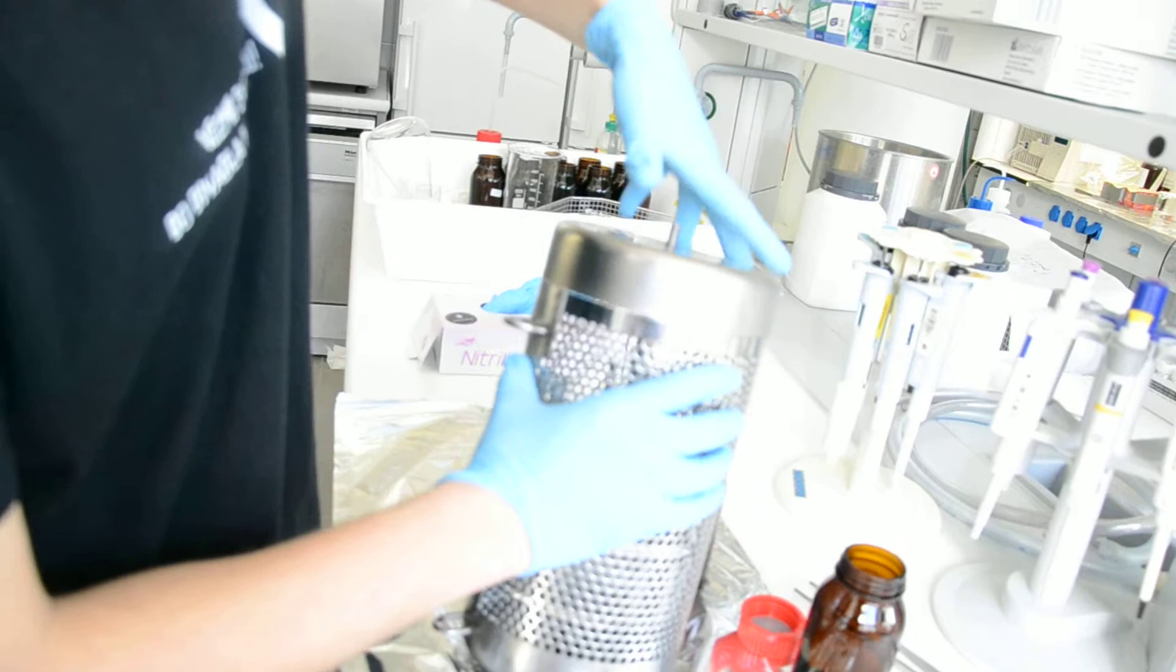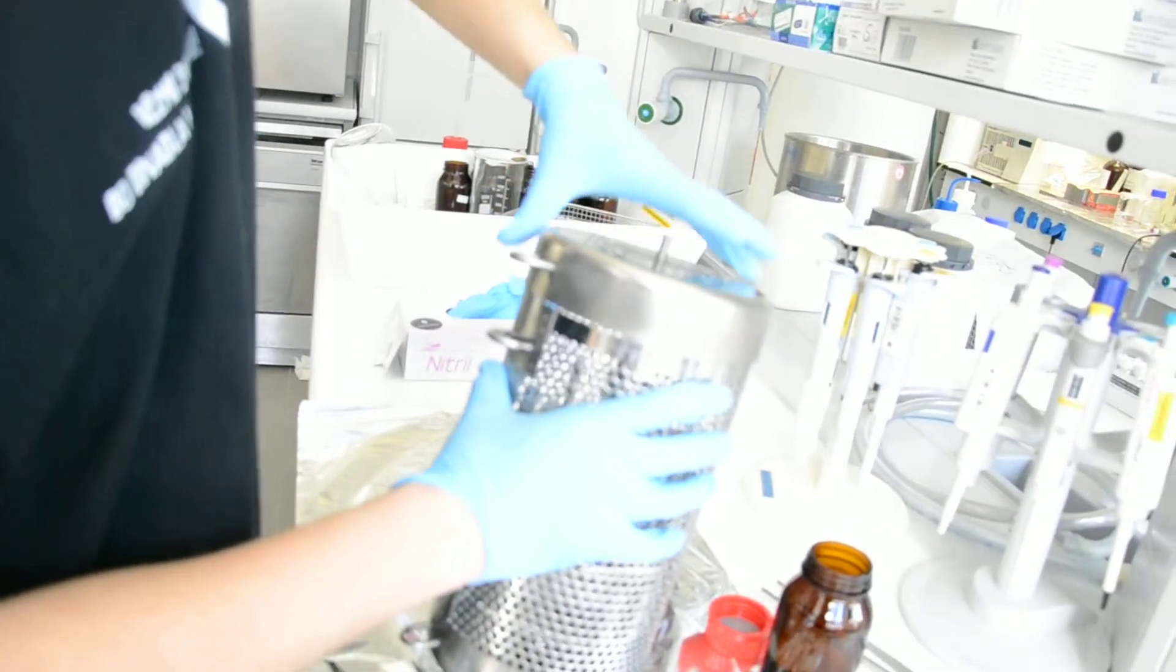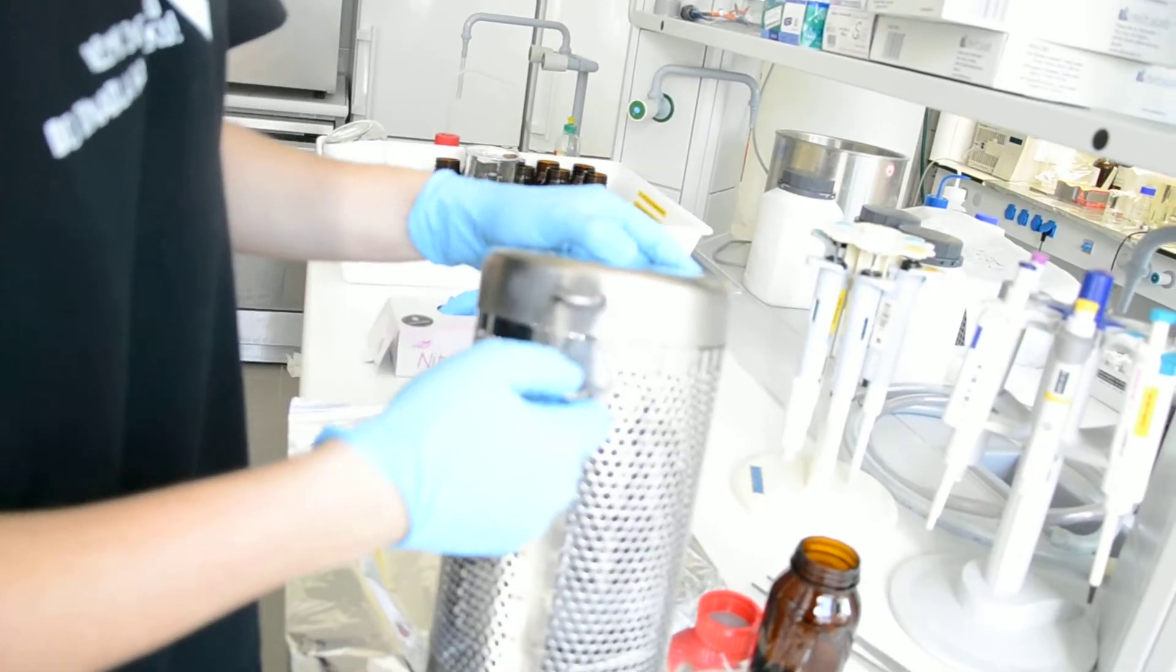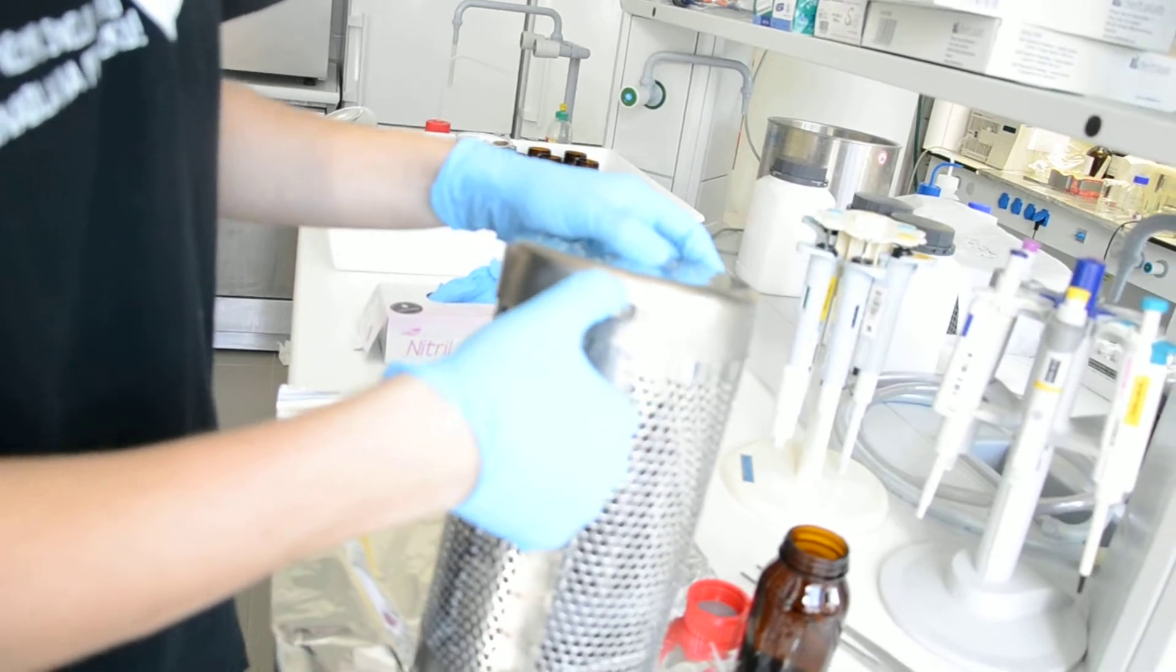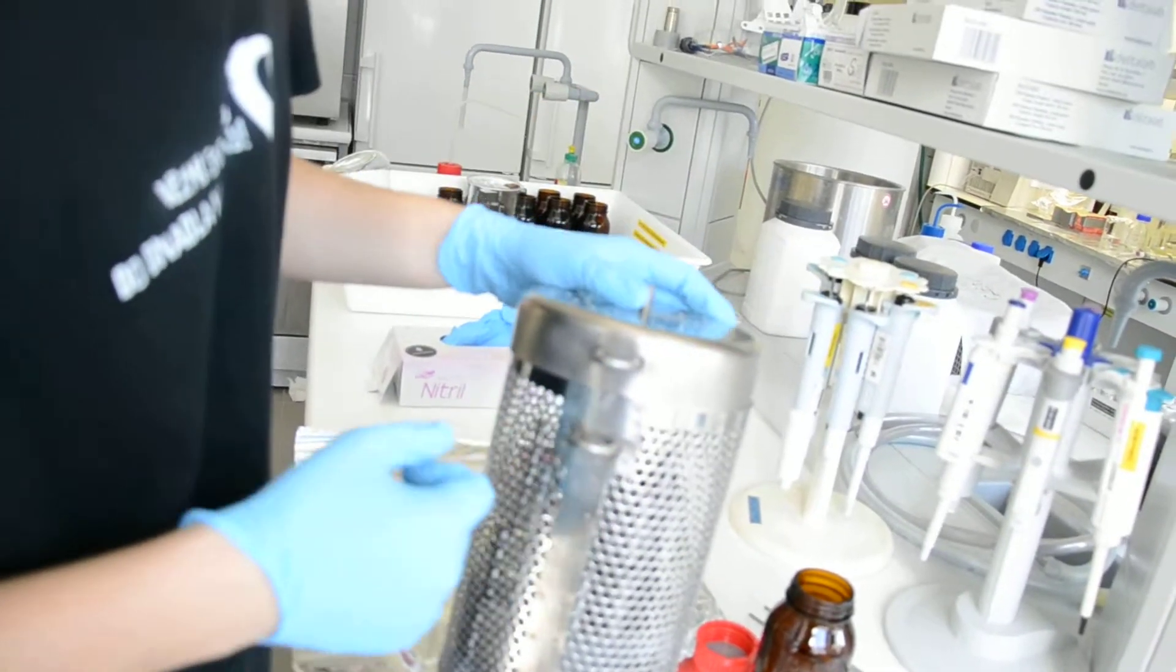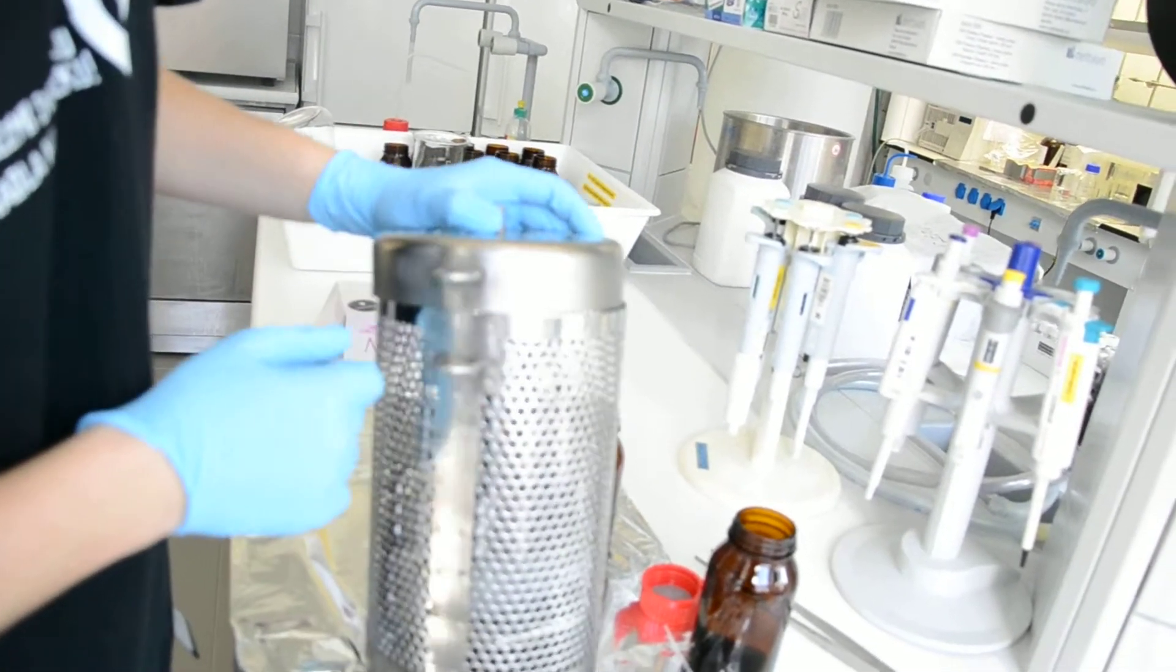Don't forget also to attach it here in order to prevent opening of the lid. And that's it.